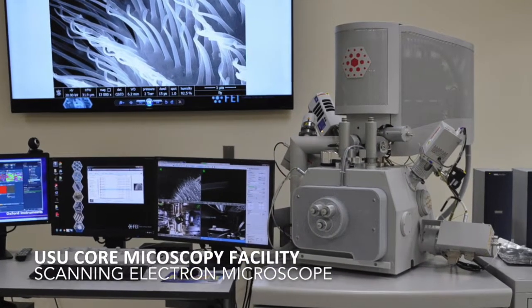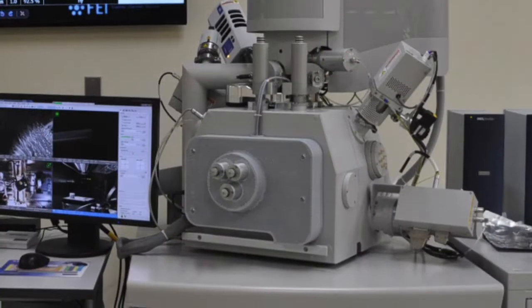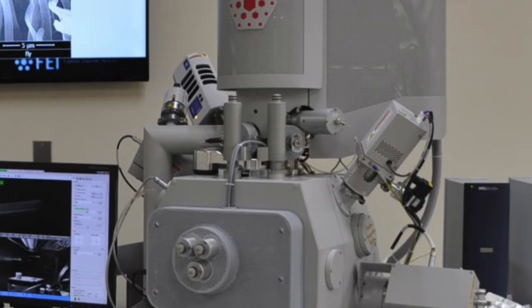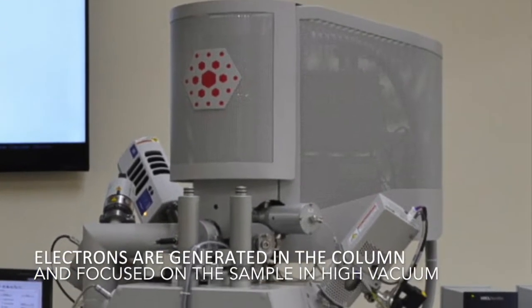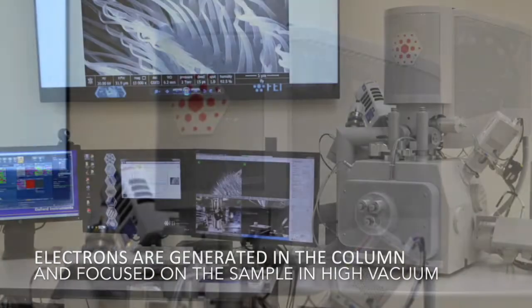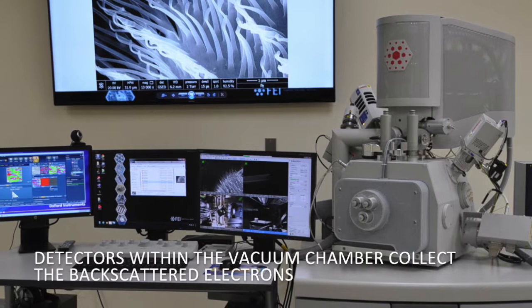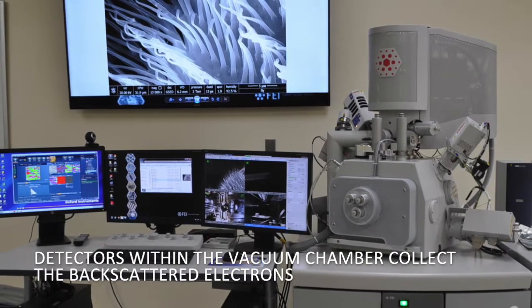You've basically got three components here. You have the vacuum chamber, which is the larger box, and on top of the vacuum chamber you have the column. And then to the left of that you've got the computer monitor, or the screen, and that's part of the processor.